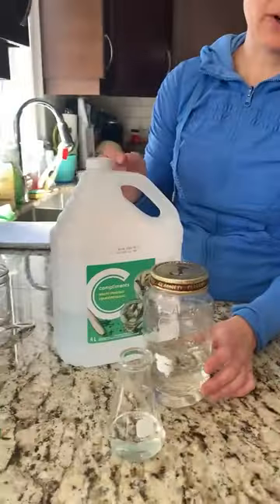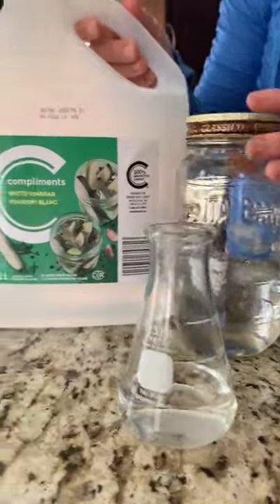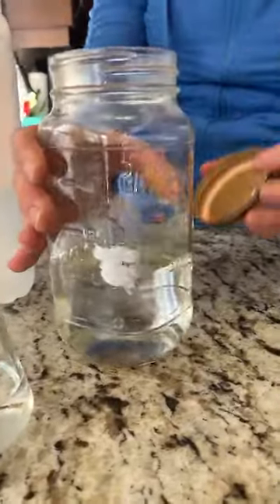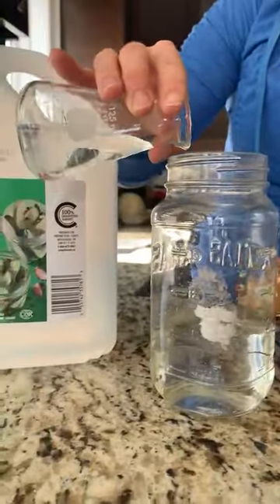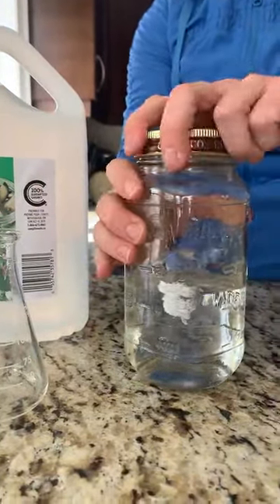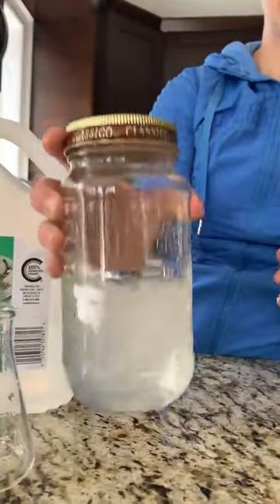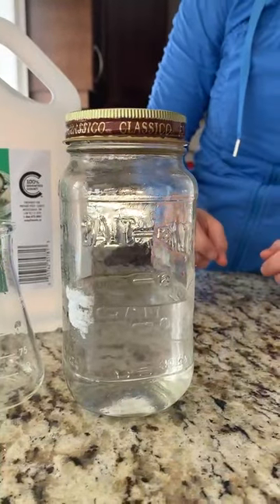Now we're going to dissolve 50 milliliters of acetic acid, which is common vinegar, into 250 milliliters of water. The vinegar, or acetic acid, is a polar compound, just like water is a polar compound. This time, when we put the lid on, we're going to give it a shake. After allowing it to settle, we can see that in fact it did dissolve.